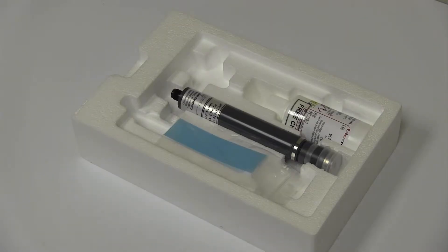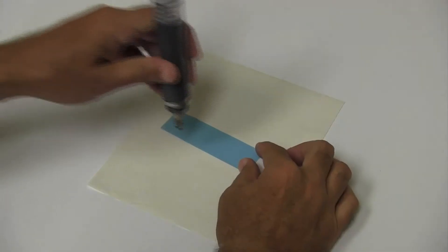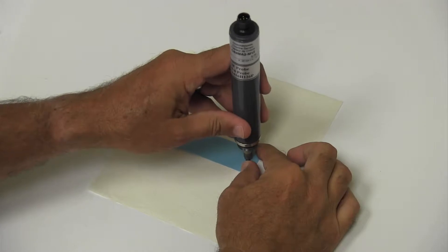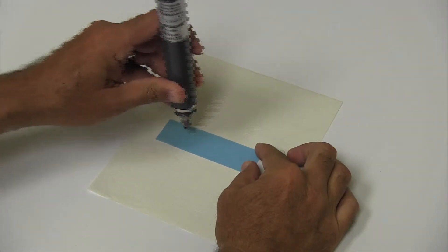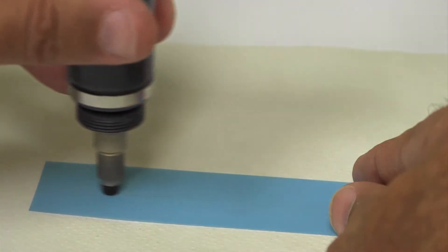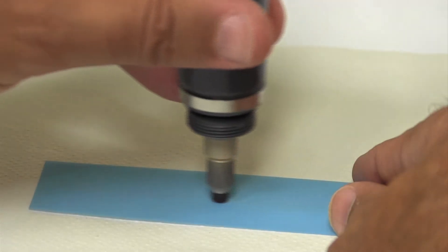The assembly process is quite simple. Clean the working electrode by placing the blue abrasive paper flat on a paper towel, and run the tip across the paper two or three times to clean the gold surface.